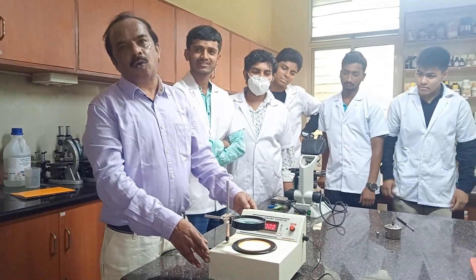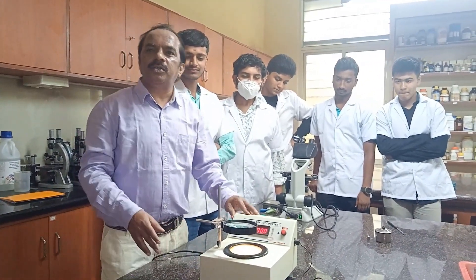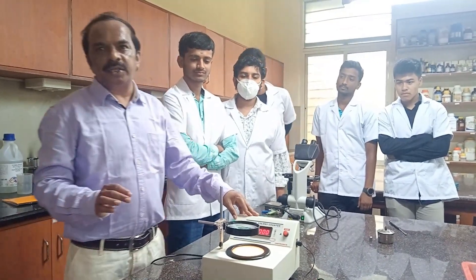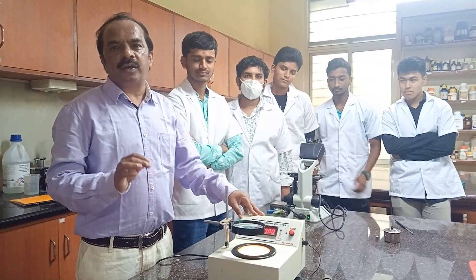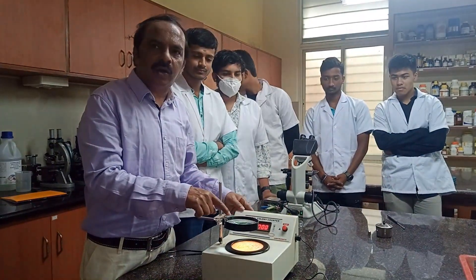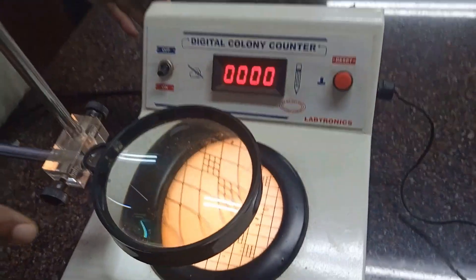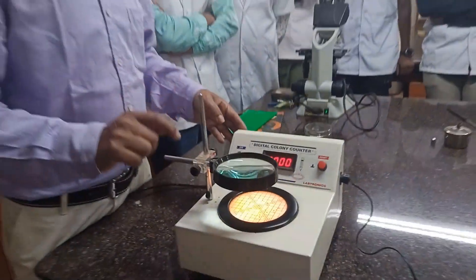This is called the colony counter, and it is used for counting the number of colonies formed on a petri dish after culturing the bacteria. You can see the colonies through this magnifying lens here.